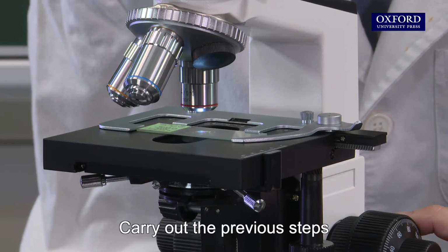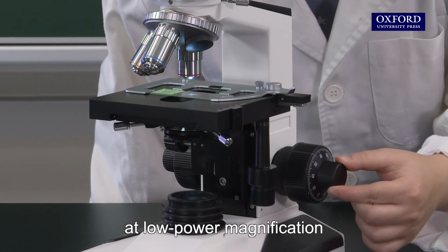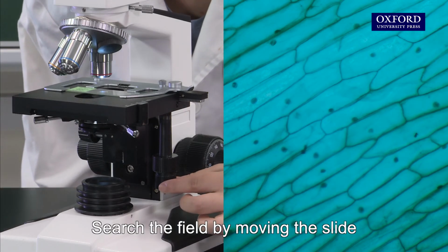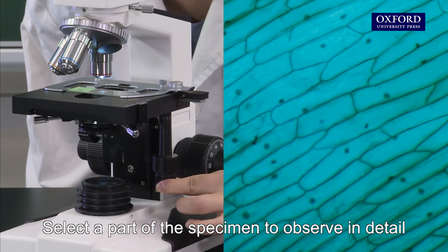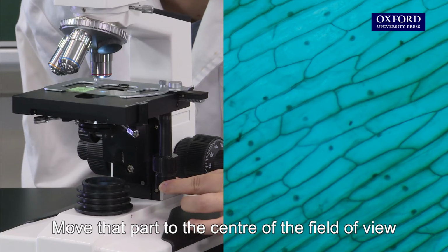Carry out the previous steps so that the specimen is in focus at low power magnification. Search the field by moving the slide. Select a part of the specimen to observe in detail. Move that part to the center of the field of view.